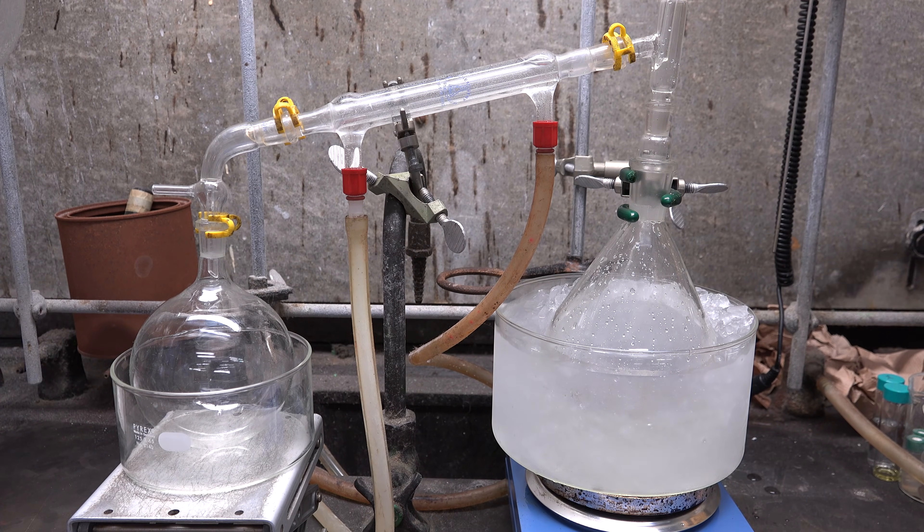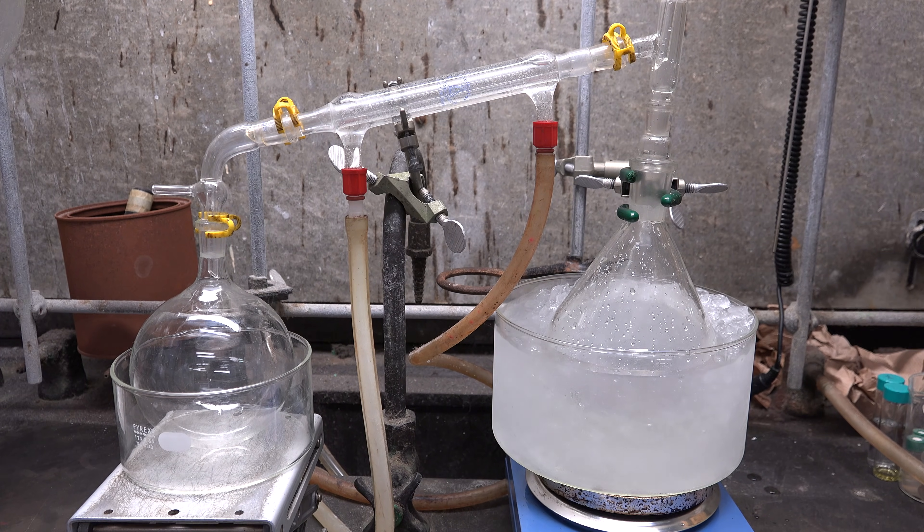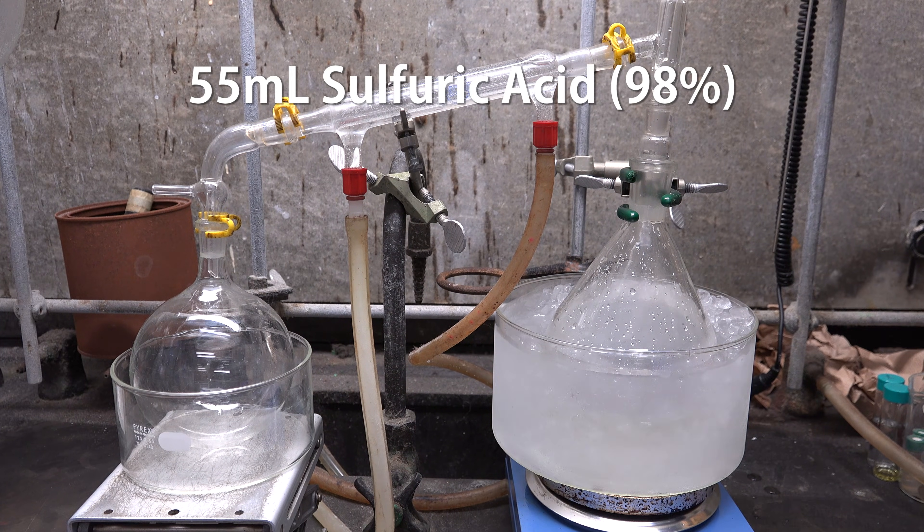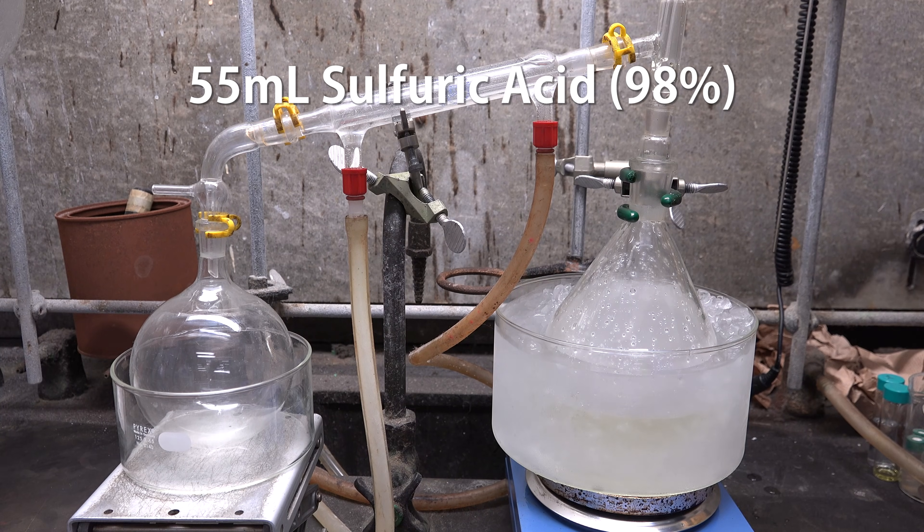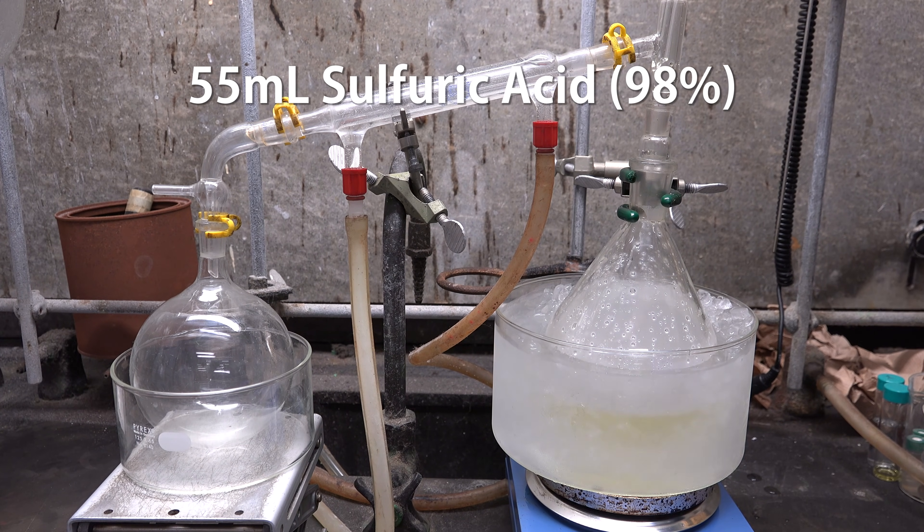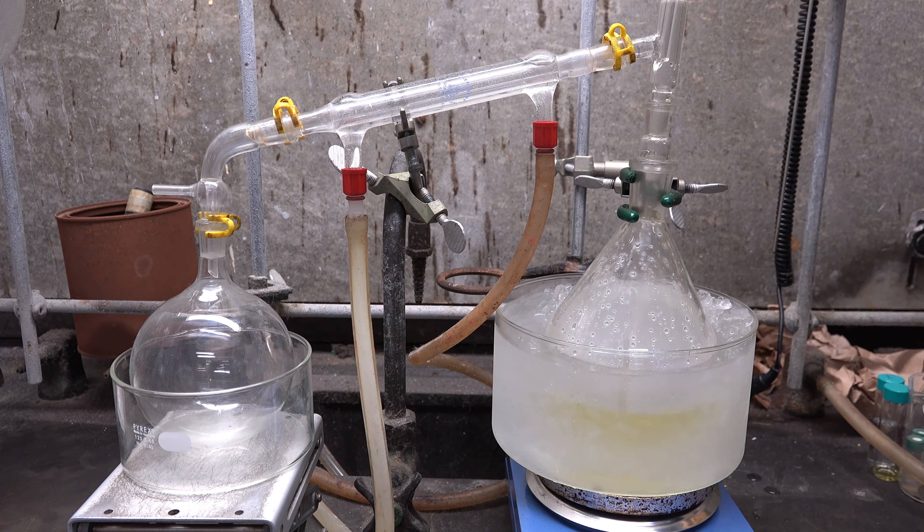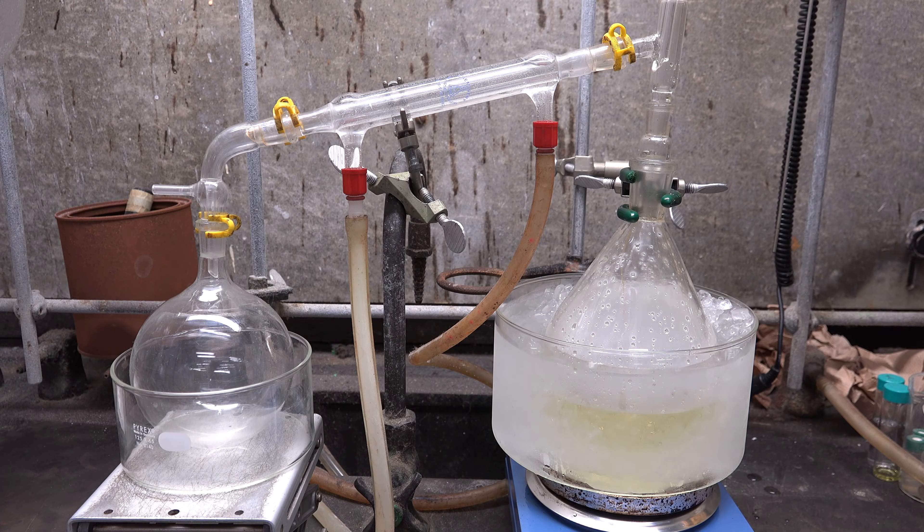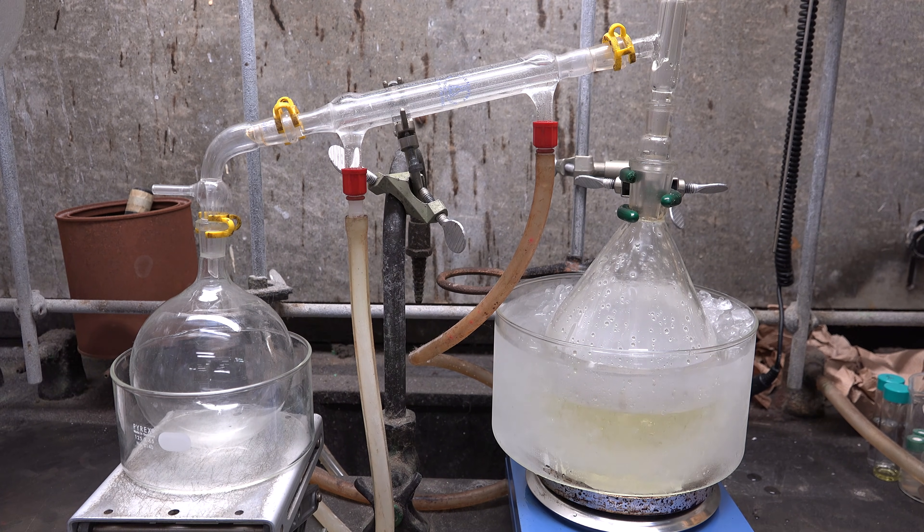Once it's all added give it 10 minutes or so to cool down. Then we add in 55 mL of concentrated sulfuric acid. Go slowly and give it time to cool. Sulfuric acid tends to heat up a lot when added to water and solutions that contain it.